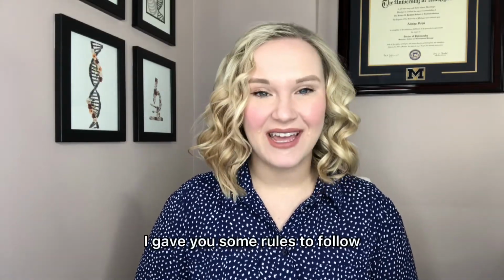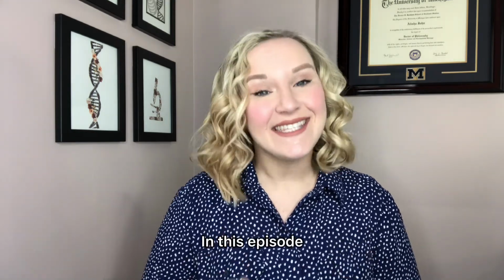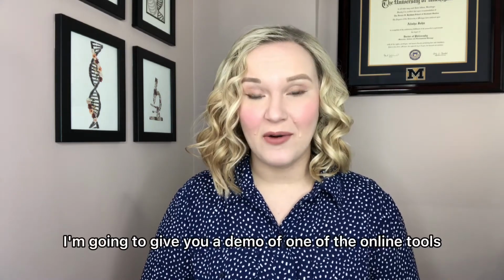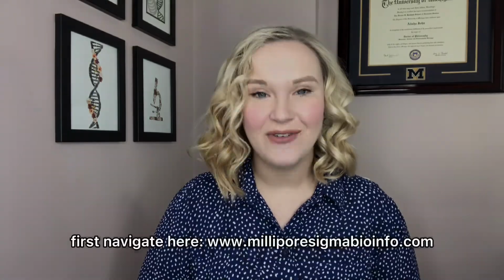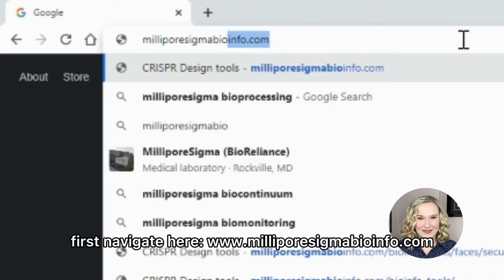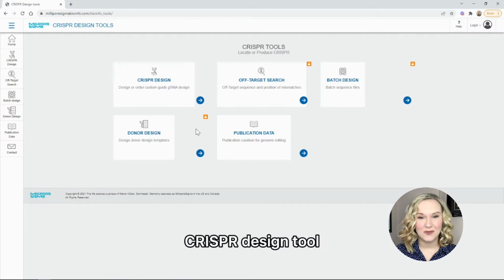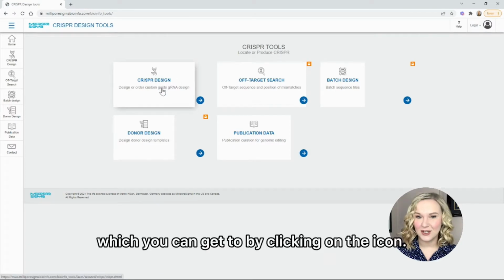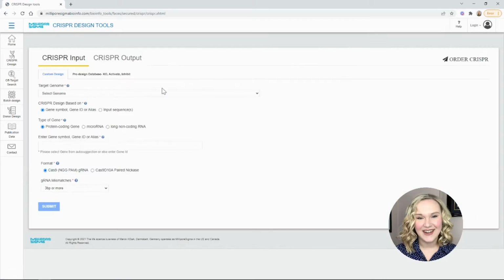Last episode, I gave you some rules to follow, or maybe break, when designing CRISPR guide RNAs. In this episode, I'm going to give you a demo of one of the online tools that I use to design guide RNAs. First, navigate here. For this demo, we'll be using the Unlocked CRISPR Design tool, which you can get to by clicking on the icon. To unlock all of the features in the tool, create a free account.